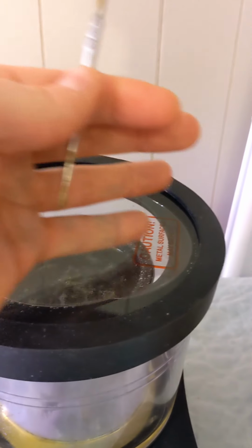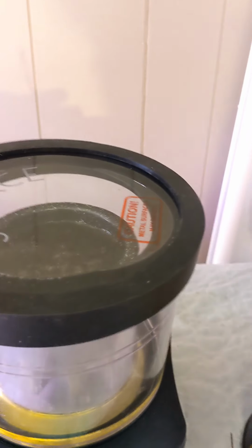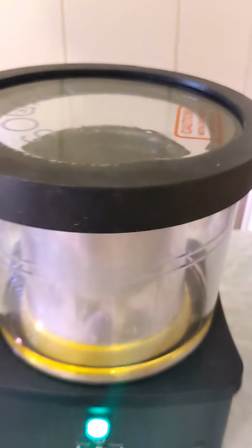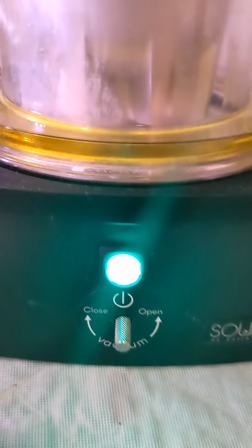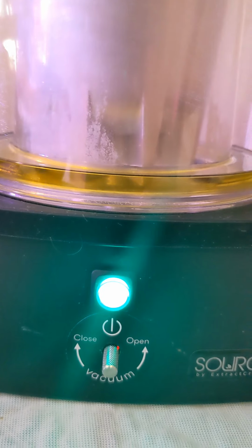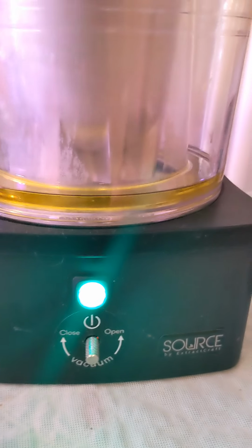The vapor hits here. Some people recommend putting ice cubes on top or something cold to help it recondense the liquid. I haven't found the need to do that yet. This is the first run I've got going on this. But in the end, all the liquid has evaporated away, which you can reclaim. That's really the biggest plus of this system. You reclaim your alcohol. Especially if you're using ethanol, it's hard to come by and expensive. You just reclaim it all.